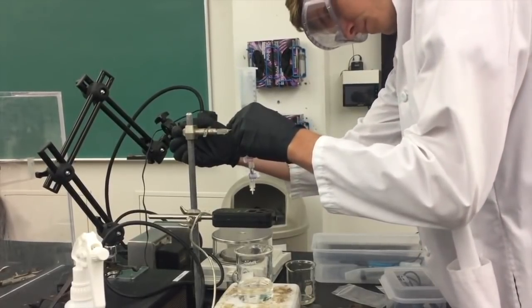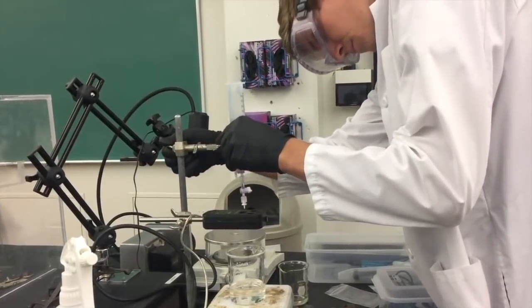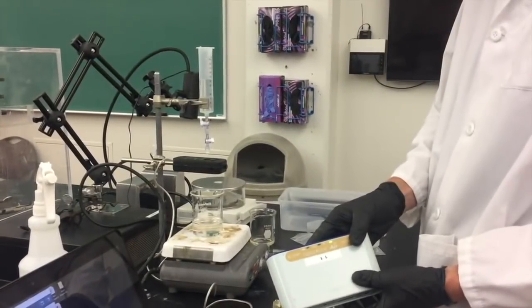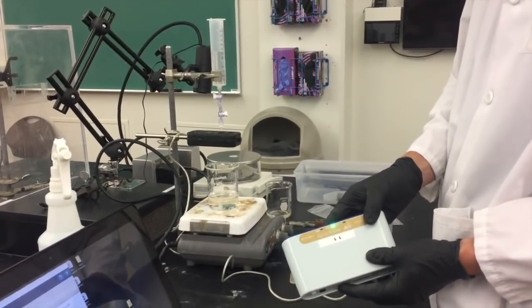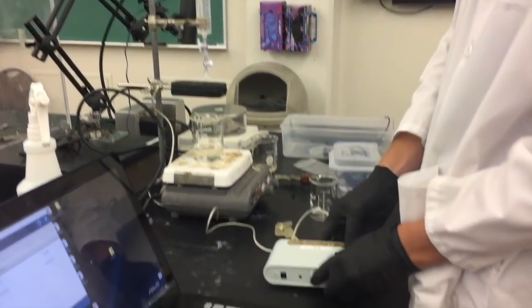We're now ready to set up the probes and meters that will be used in your titration. At this point you should turn on your SparkLink Air unit. Make sure that you see the green flashing light before you move forward.